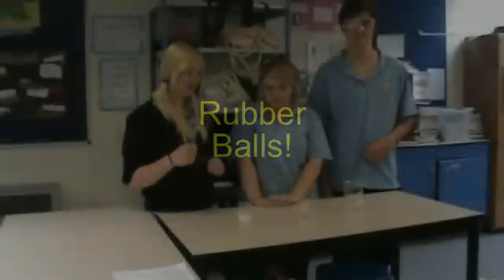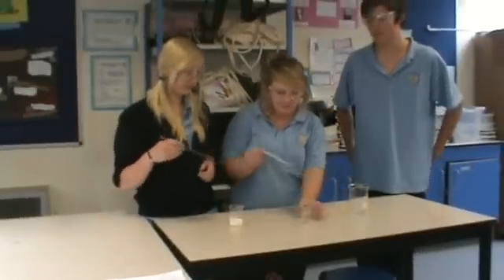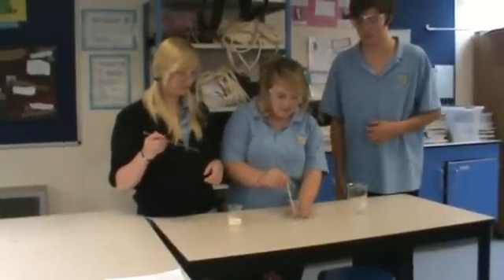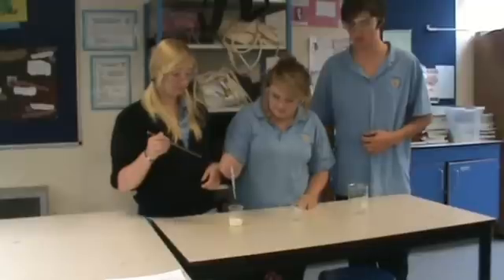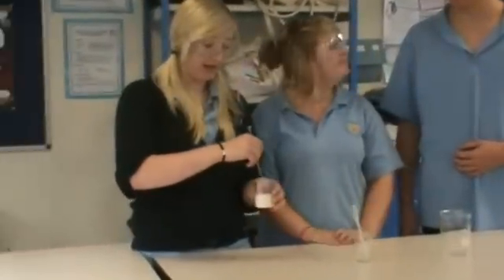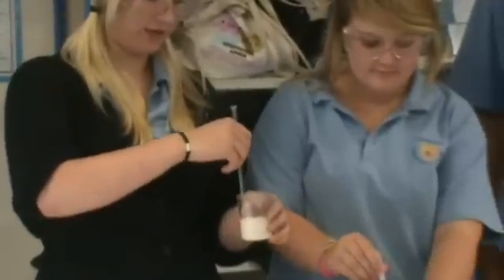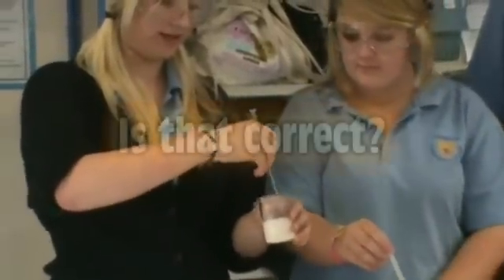We are making a rubber ball. First of all, you need to pour 20ml of the latex solution into a beaker and add a couple of squirts of vinegar or lemon juice, and mix. You can add more lemon juice or vinegar if the liquid sticks in the beaker and doesn't start sticking to that stirring rod.